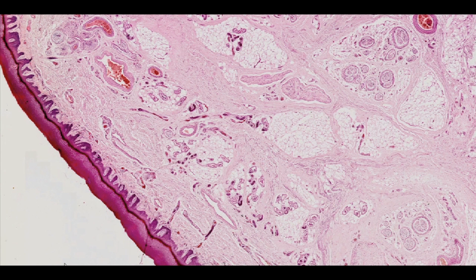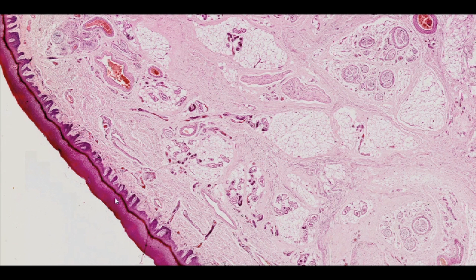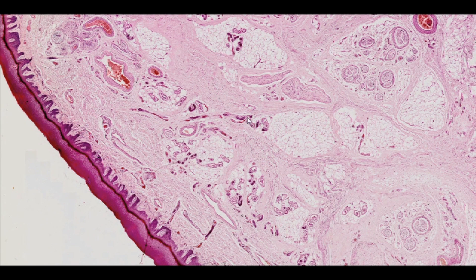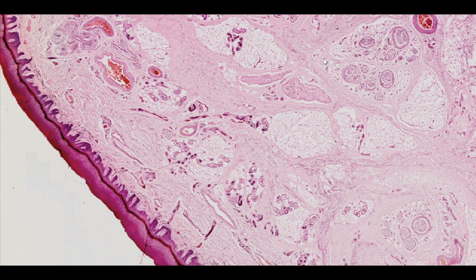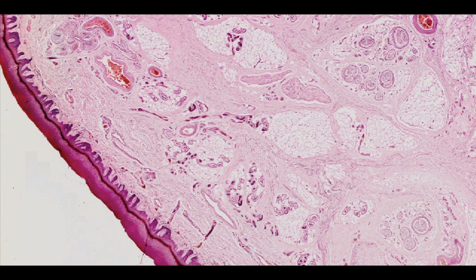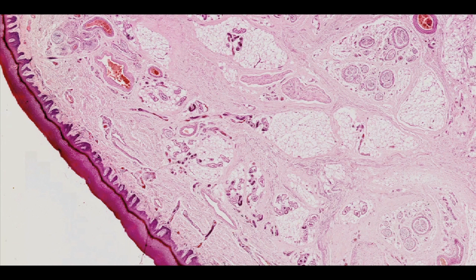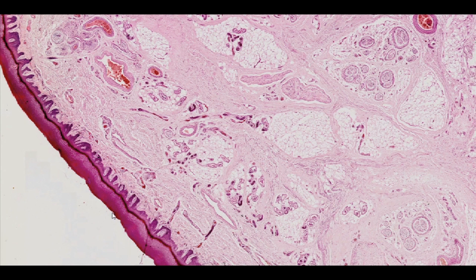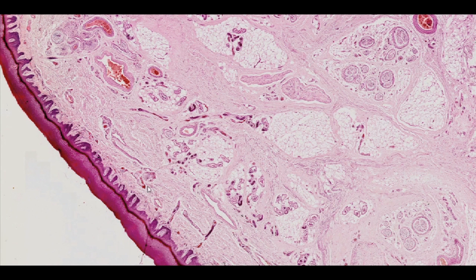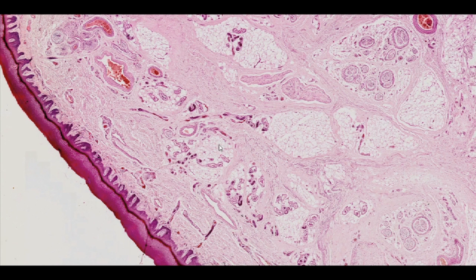The skin is a composition of two interconnected tissues: epithelial and connective tissue. It covers almost the entire body and its primary role is to protect against harmful environmental factors such as mechanical injuries. The skin consists of three layers: the outermost epidermis, the underlying dermis, and the innermost subcutaneous tissue.